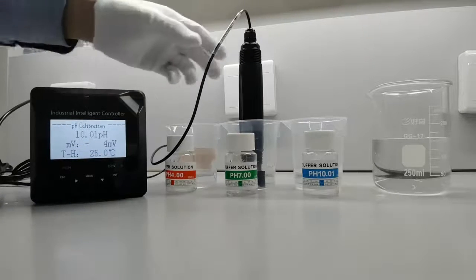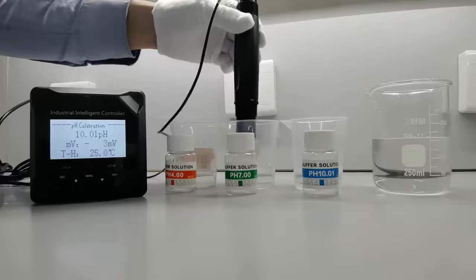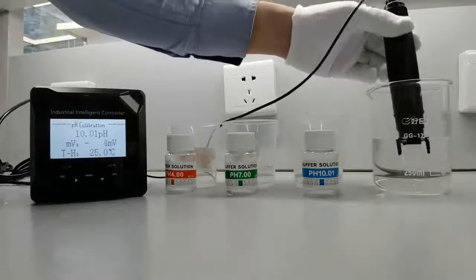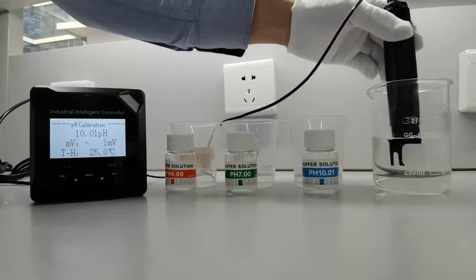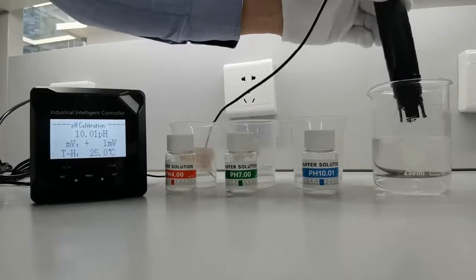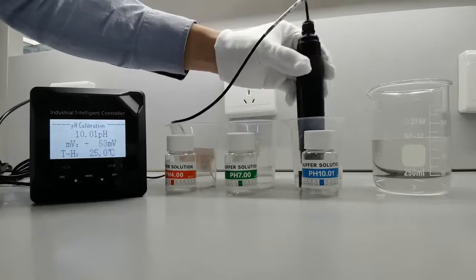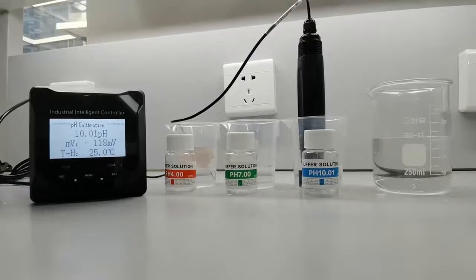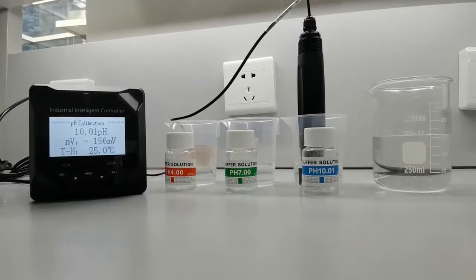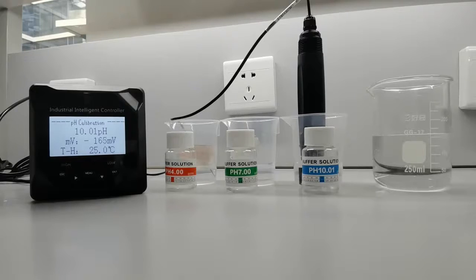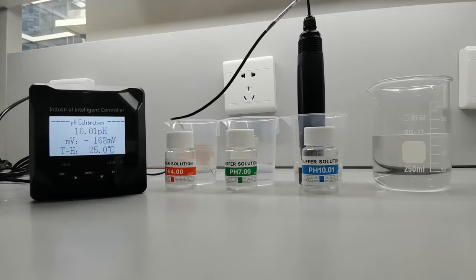Rinse again with distilled water, then immerse in pH 10 solution. After immersion in pH 10, wait until the measurement is stable. The calibration is now complete.